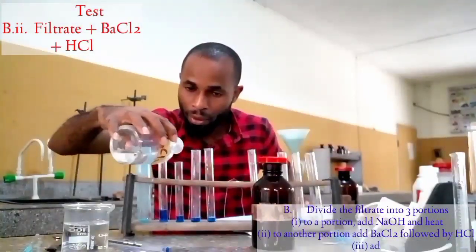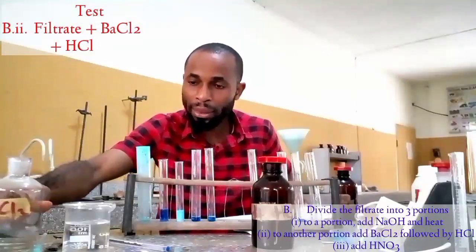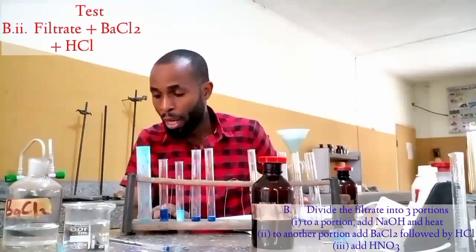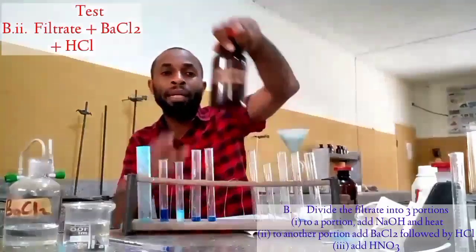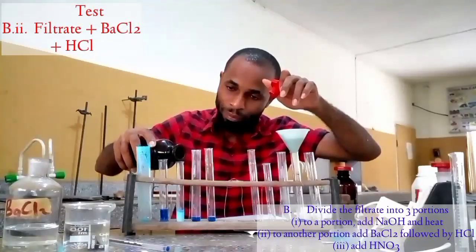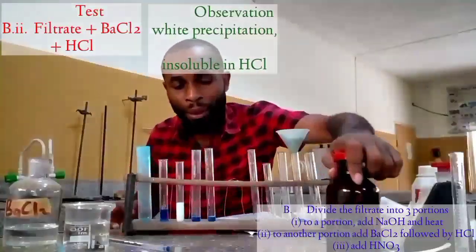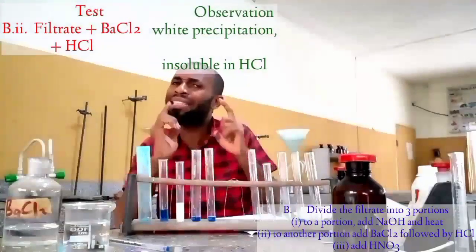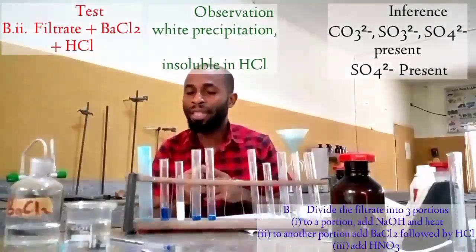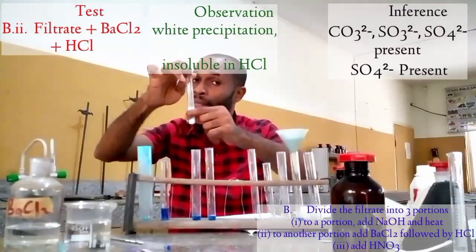If you look at it, you're going to have a white PPT, that is a white precipitate, and let me add the hydrochloric acid. We still have the white PPT, but there's something I want to tell you. Remember I said earlier that this contains about 4 or 5 ions inside it. This proves that this thing here is sulfate. That means that there is sulfate in this.